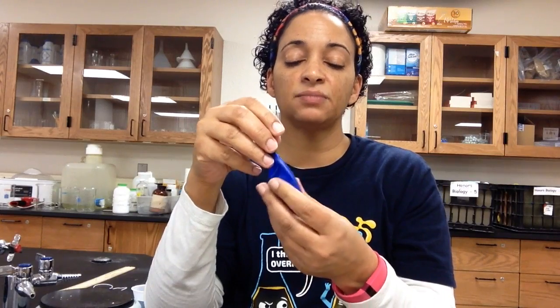Now I'm going to repeat this for all four of my other balloons, including my control balloon. Then I'm going to let them sit for 20 minutes. After 20 minutes, we'll come back and see which balloon is the biggest — which means that yeast preferred that sugar and made the most carbon dioxide. I hope you enjoy the lab!